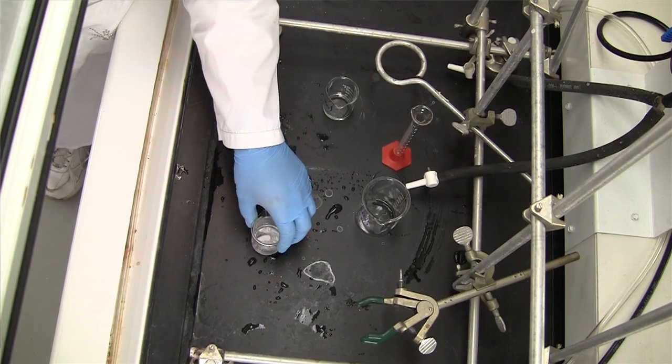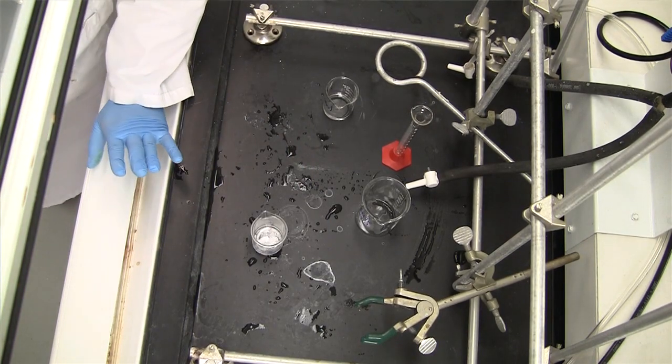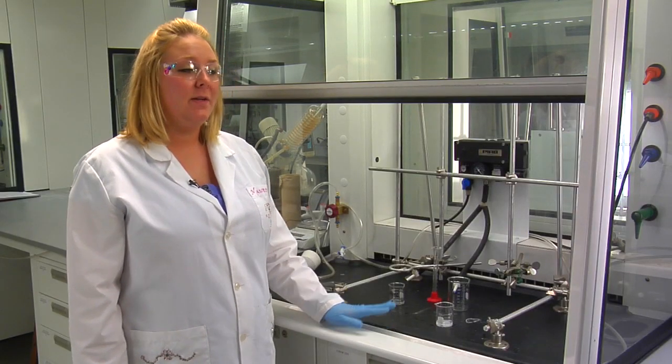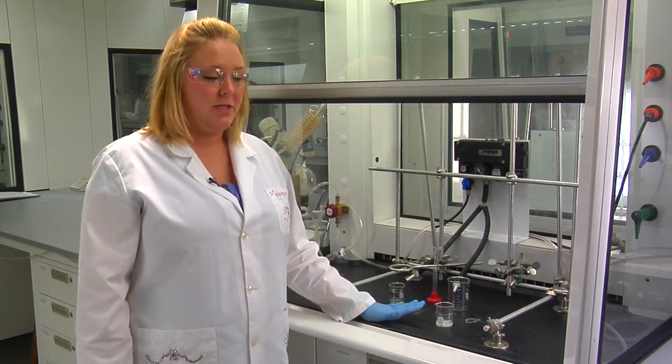Once it's completely dissolved, you're going to allow it to heat on the steam bath for an additional 10 minutes. Then we're going to remove it and let it cool at room temperature to allow recrystallization.